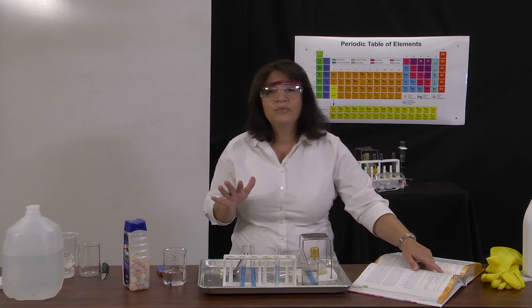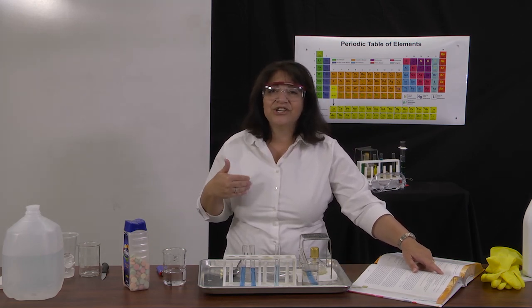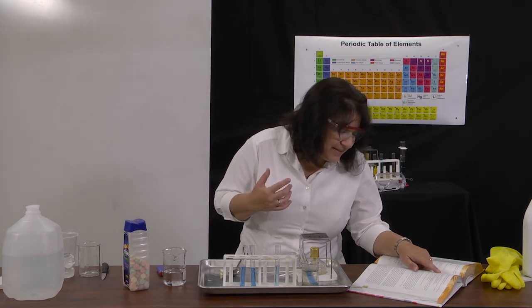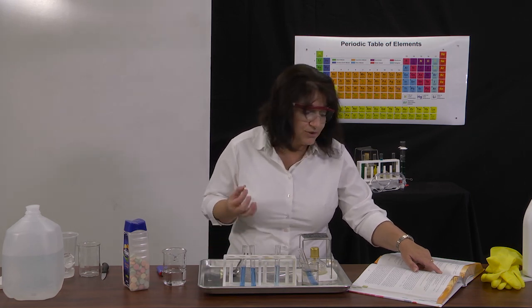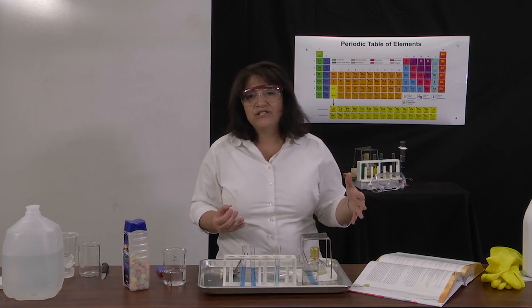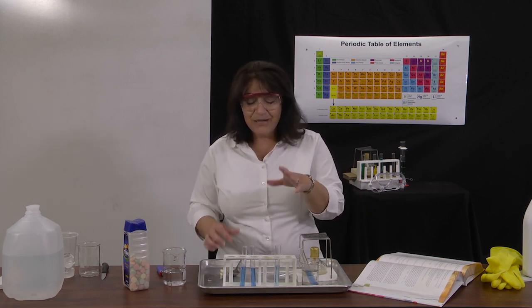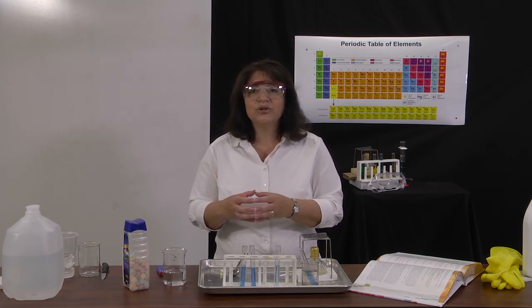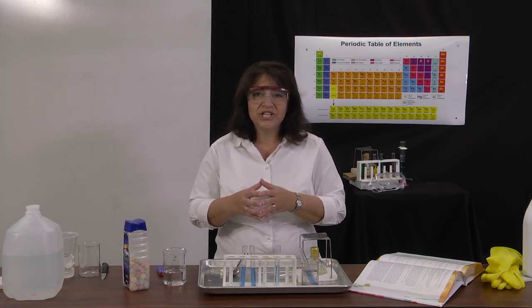Okay, now we want the toilet bowl cleaner in that to get hot. So we'll see how this chemical reaction occurs under warm or hot conditions. And then we're going to put a regular antacid tablet into test tubes 1, 3, and 4. So you need to number your test tubes unless you can remember which ones they are. If you're keeping your test tubes in a beaker, like the lab is suggesting, then you will need to use a pencil or some tape and a pencil to number them so you know which ones are under which conditions.